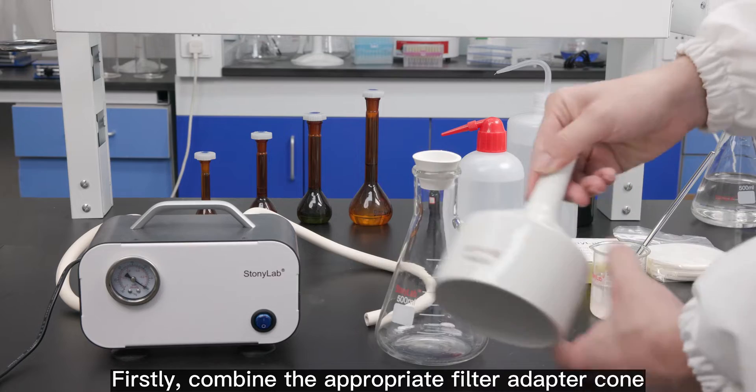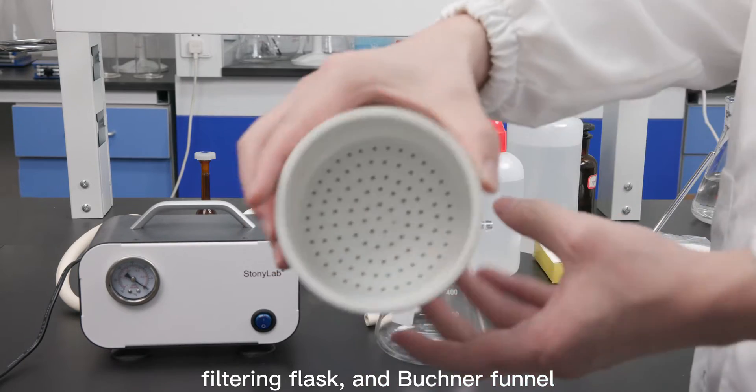Firstly, combine the appropriate filter adapter cone, filtering flask, and Buchner funnel.